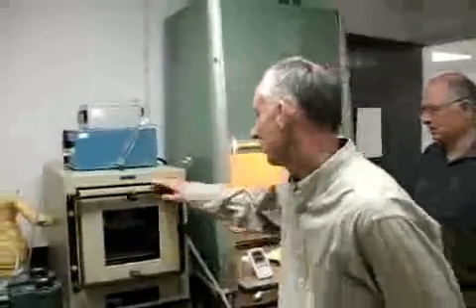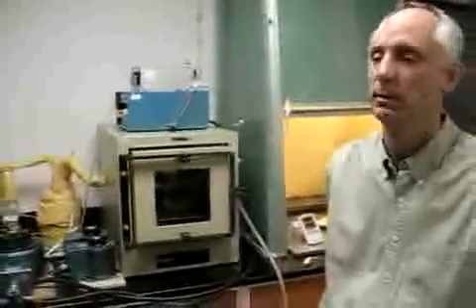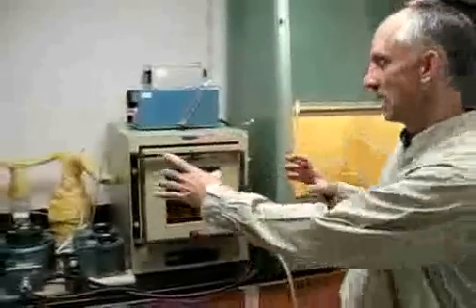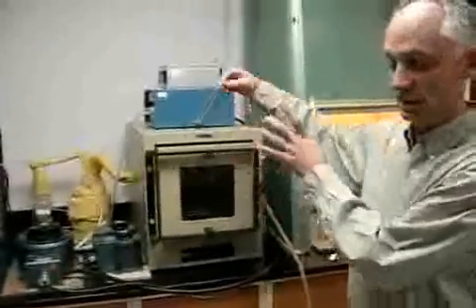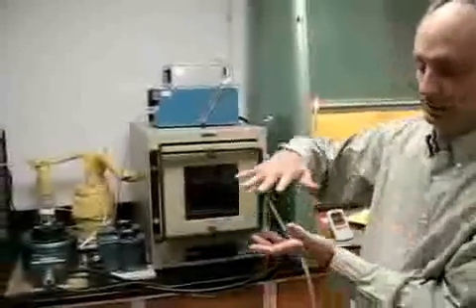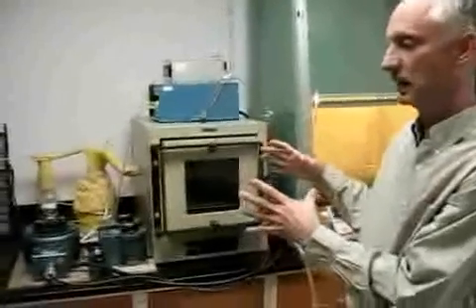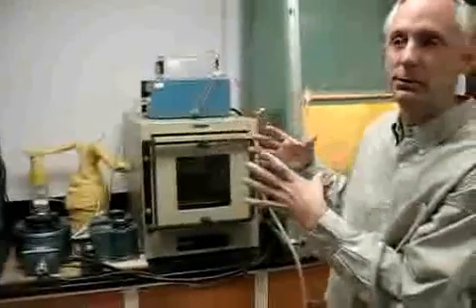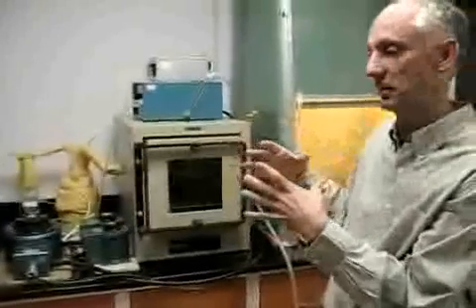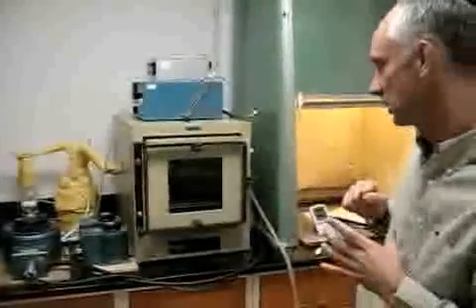Okay, what we have is an incubator that we're temperature controlling to a temperature of 52 degrees C with a tolerance of plus or minus 2 degrees C, both in variation in time and space within the oven. We verified this by measuring air temperature in various locations, and a surrogate of samples. We used sand, fairly coarse sand, placed thermocouples in that, and those are actually far less variable in temperature during time than the air is, as you would expect, because of the thermal mass of them. So the samples are going to be more stable even than the air in terms of temperature fluctuation.